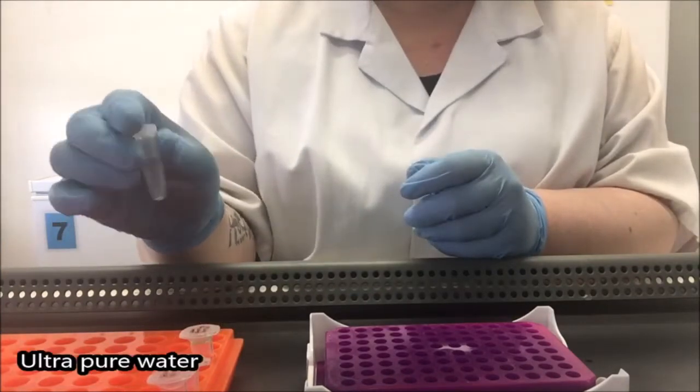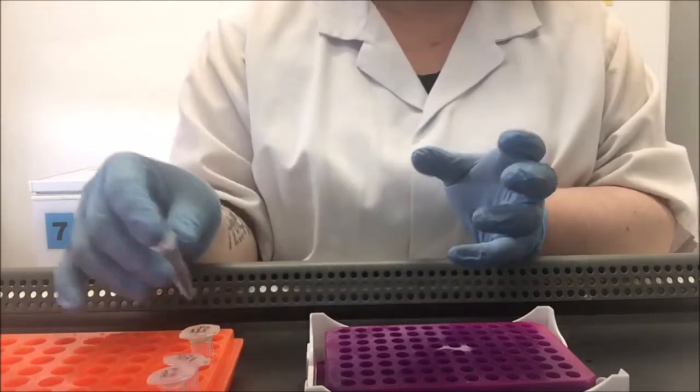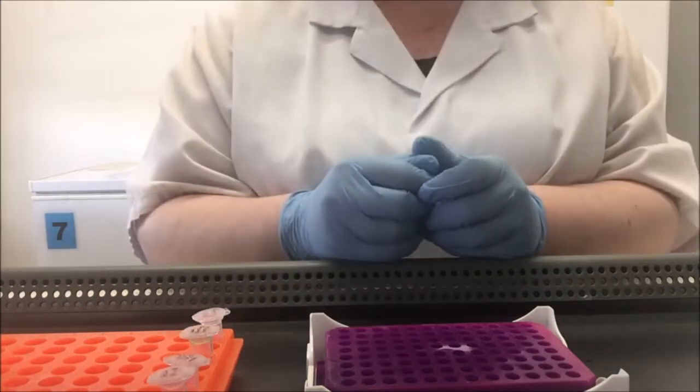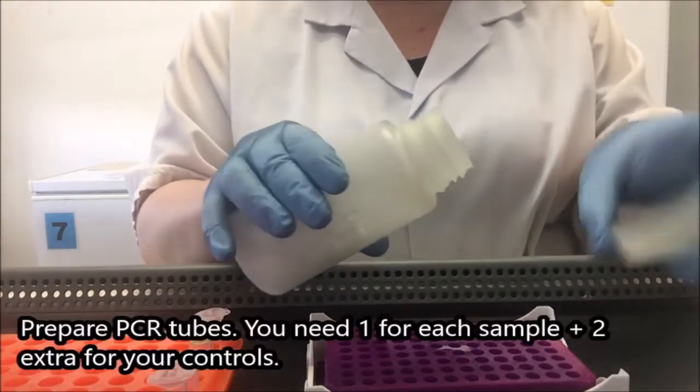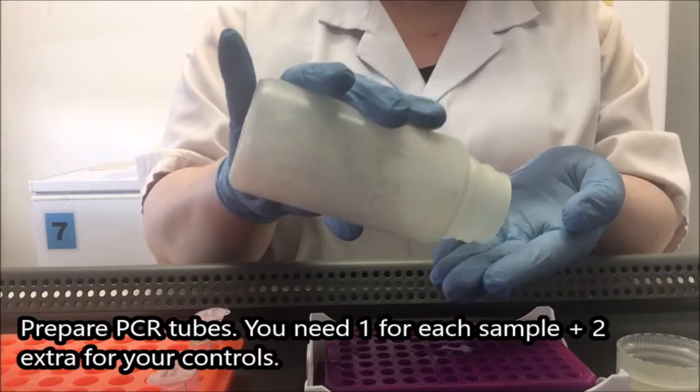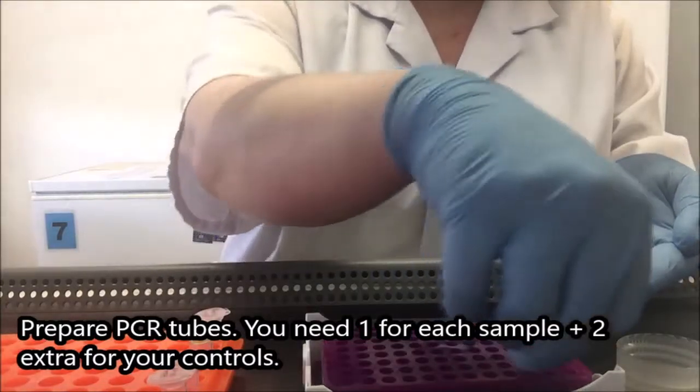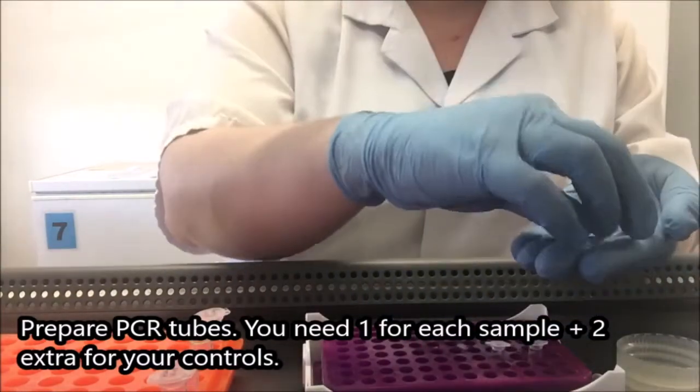And I also have some pure water. So this is very pure water. It doesn't contain DNA or DNA damaging enzymes. Okay, so the first thing I'm going to do is get my PCR tubes. So as you've seen with microcentrifuge tubes, I'm not putting my hand in the container. And I'm putting the lids on them as quickly as I can so that they don't become contaminated.